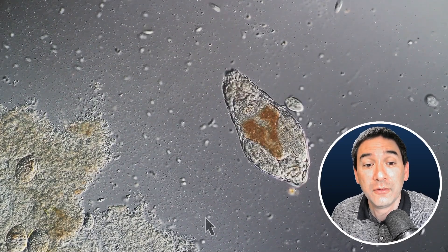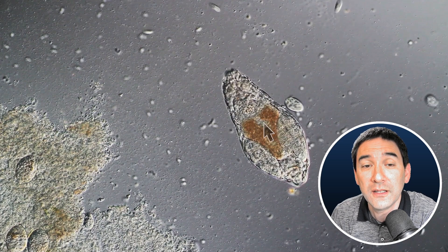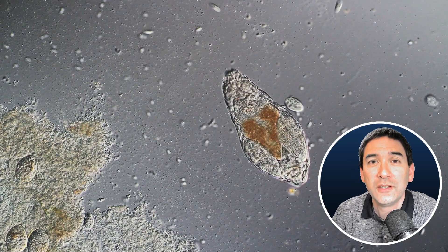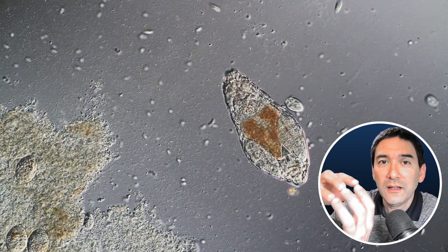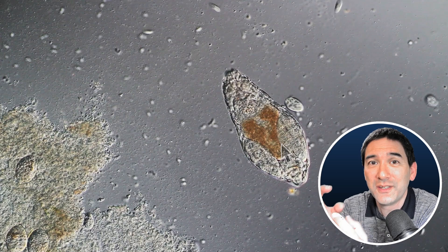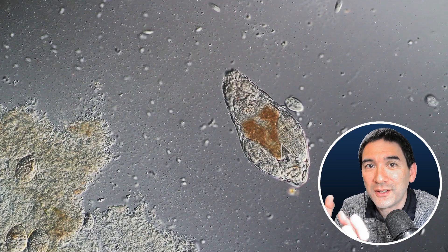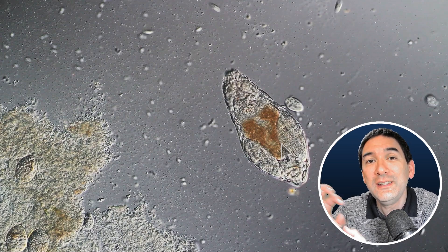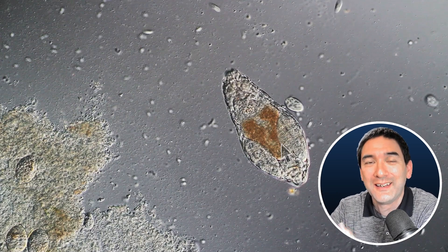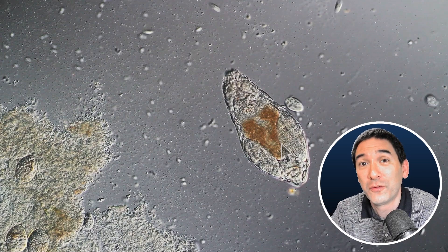So again, let's have a look here. If you look inside here, you are able to see that there's a different color, and that's because of the food that it has eaten, but I'm not able to see the individual round cells. The reason is that the cell in the middle is surrounded by other cells. And so this means that the refractive index of one cell is the same as the surrounding other cells, and for this reason the cells kind of blend into each other, just like a cup of water inside water would kind of blend in.